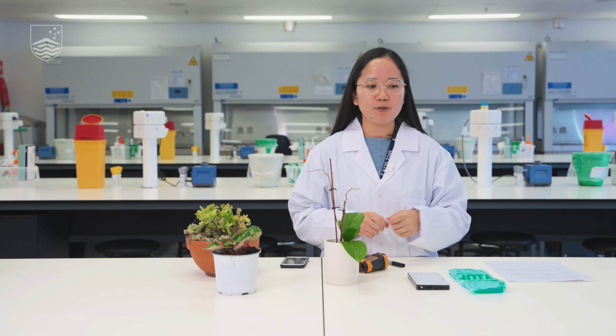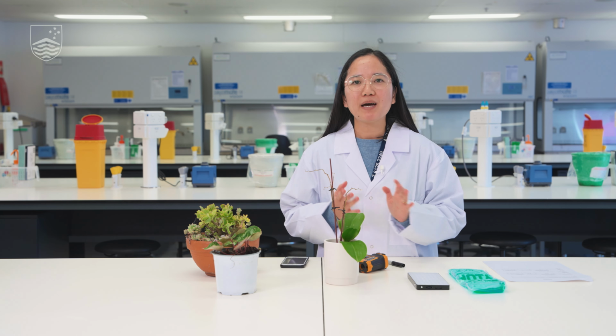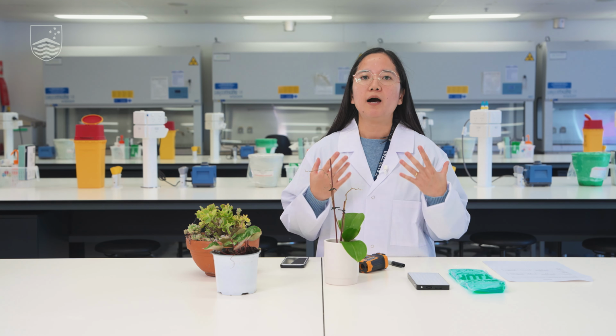So of course, when we do our measurement of the leaf, we will know what temperature it is under normal conditions. Now, it is obvious that if we treat it with heat or cold, the temperature will fluctuate. But what is interesting here is how the plants recover from that. And measuring the time it takes for them to recover back to their normal state will allow you to know how the plants acclimate to different temperature changes.